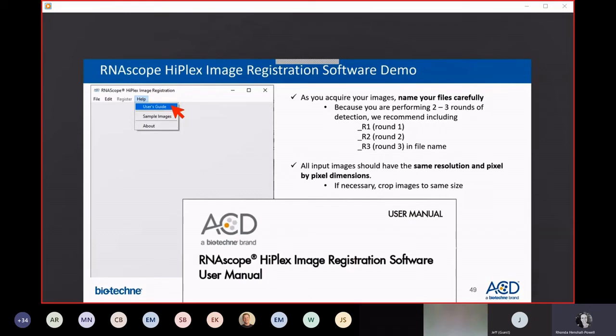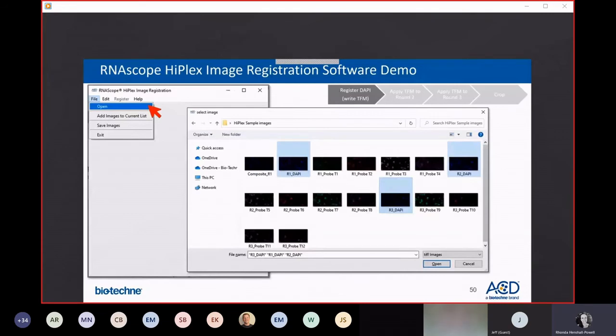The other really important thing here is the software requires that images that you're trying to overlay are the same size, same resolution, same pixel by pixel dimension. So if necessary, use Fiji and crop your images to the same size. You'll also need single channel images. So from that composite image you capture at the microscope, separate the channels and save each channel as its own separate file. If you do a 12-plex, for instance, you'll have a total of 15 files, 12 for your probes of interest, and then 3 for the DAPI from each round of staining. And it's these DAPI images you use first to write your transformation matrix.